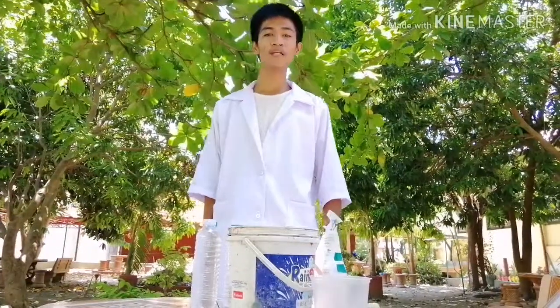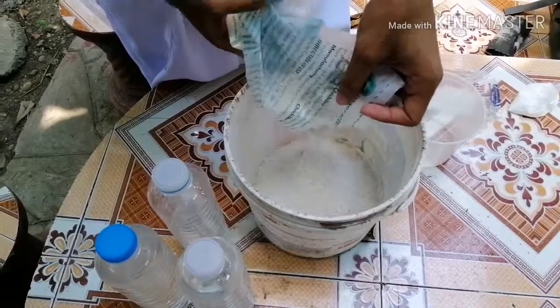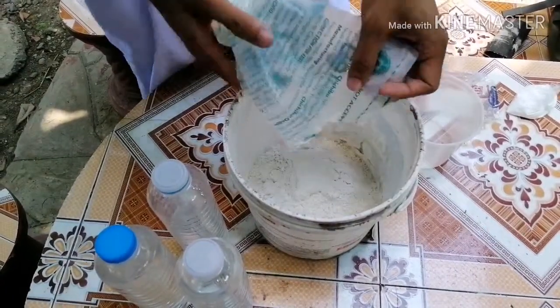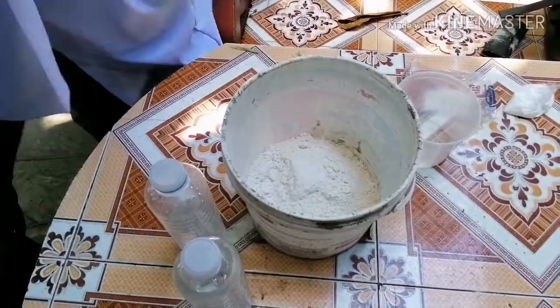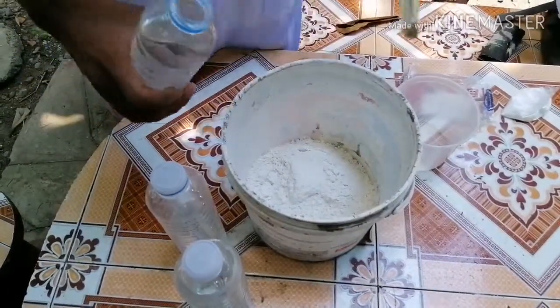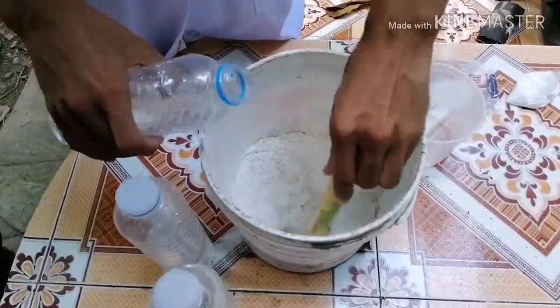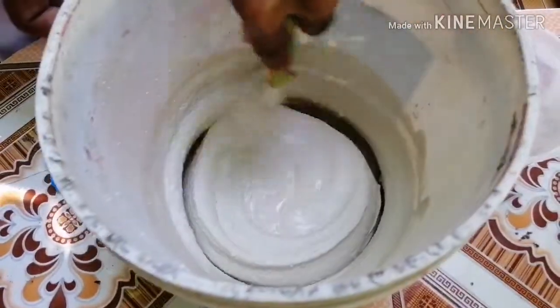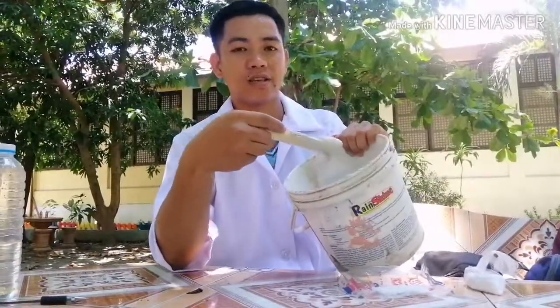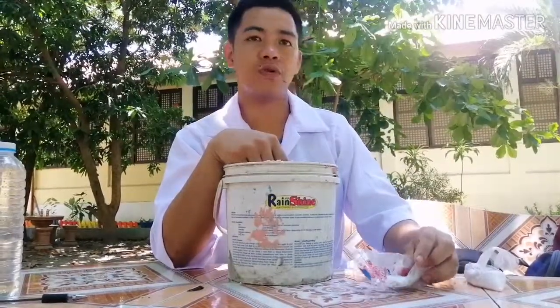Slowly add water to the cement. Mix it thoroughly until the consistency of a hotcake batter is attained. Add one half teaspoon of salt.